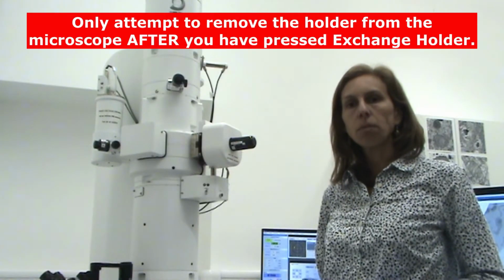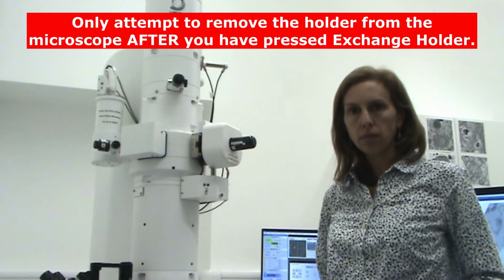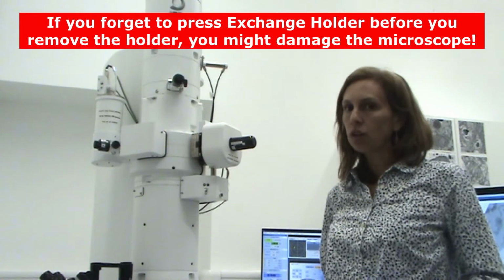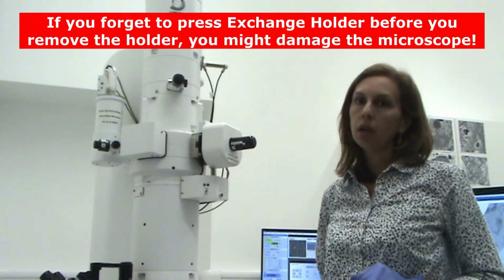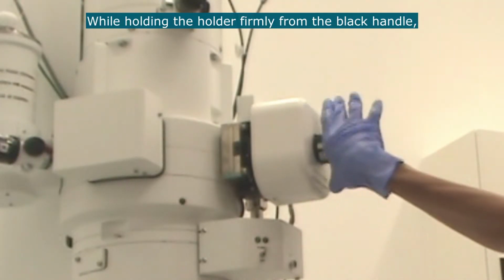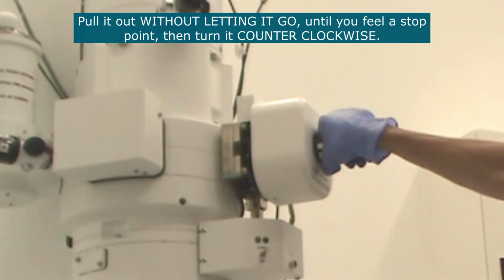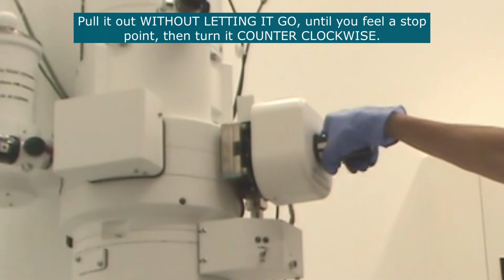Only attempt to remove the holder from the microscope after you've pressed Exchange Holder. If you forget to press Exchange Holder before you remove the holder, you might damage the microscope. Whilst holding the holder firmly here, pull it out without letting it go until you feel a stop point, then turn it counterclockwise.